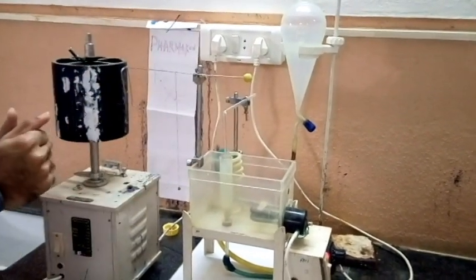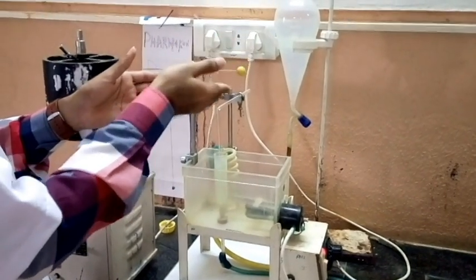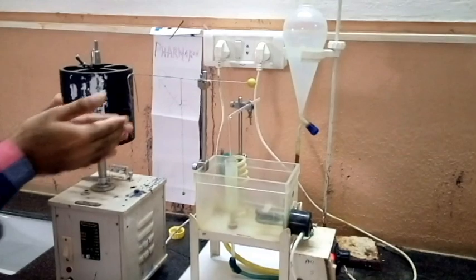Before we start the organ bath, we should balance the lever by providing equal tension on both sides, and the tension should be such that we should be able to move it very freely.